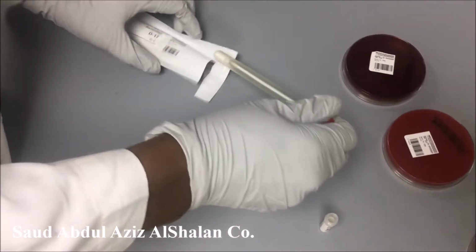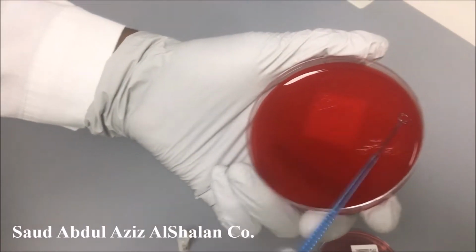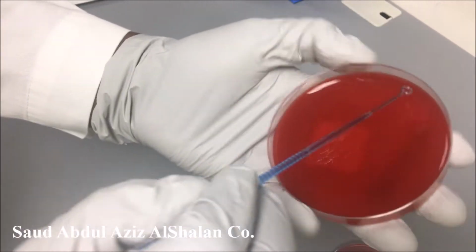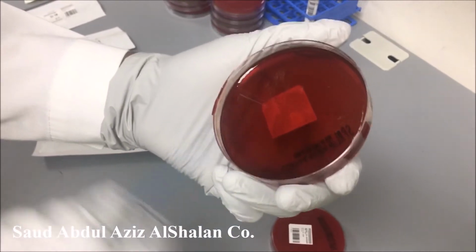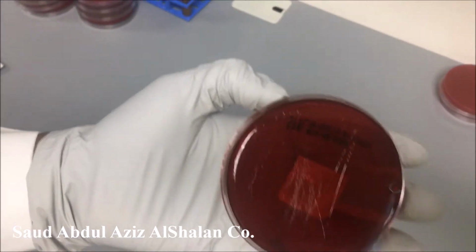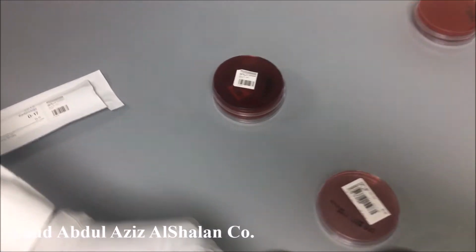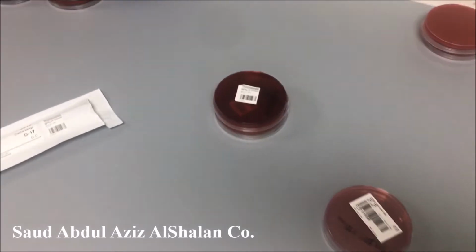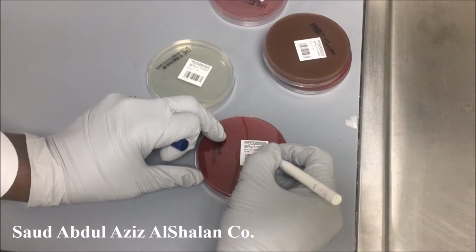The last thing, we'll streak the anaerobic plates, the two plates. And of course, a metronidazole disc should be added, because as we know, all anaerobes are sensitive to metronidazole. We didn't mention the date, we need to mention it.